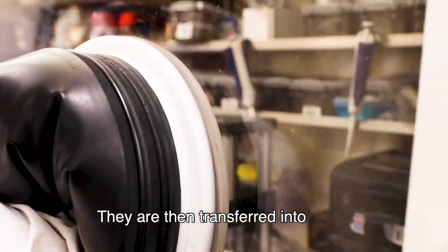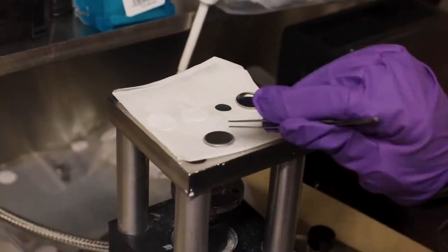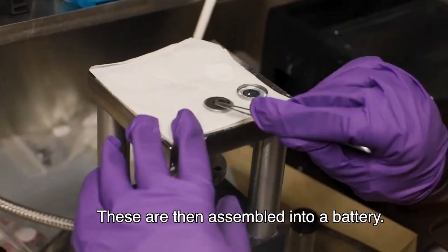They are then transferred into an argon-filled glovebox to avoid the electrodes and electrolyte from reacting with moisture and oxygen from the air. They are then assembled into a battery.